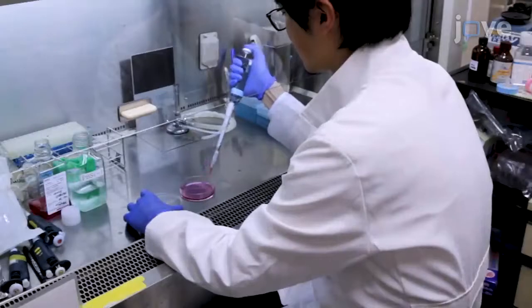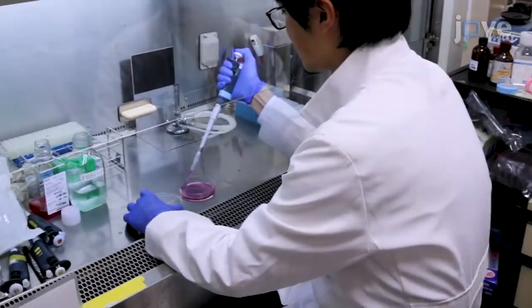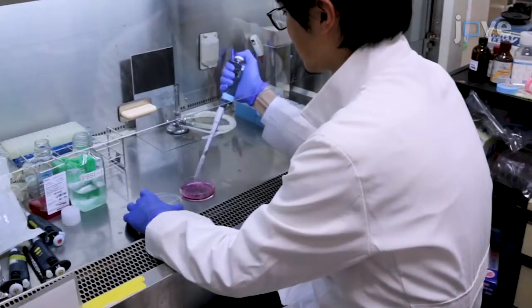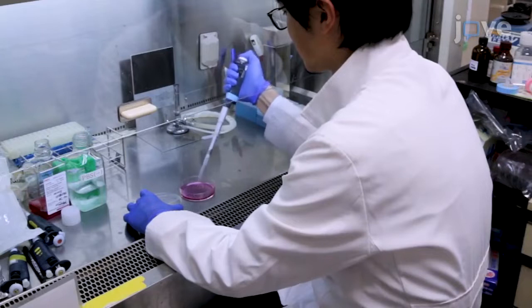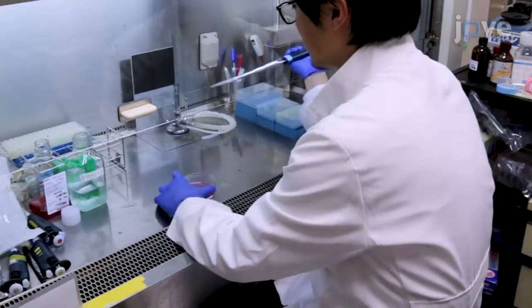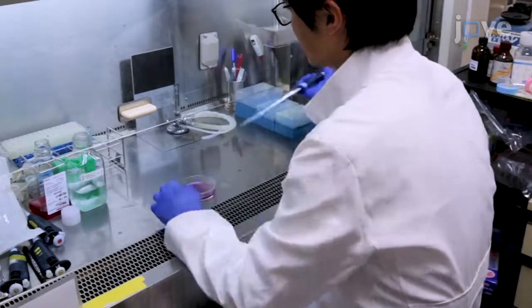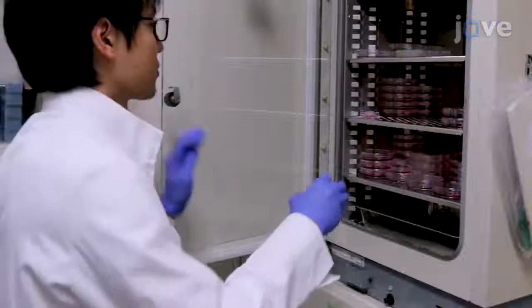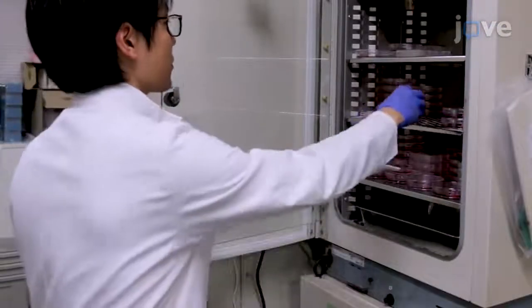Begin by seeding 5×10⁵ HEK293T cells into a 100mm dish with 10ml of DMEM and incubating them overnight at 37°C.